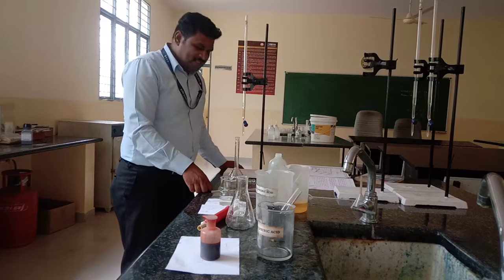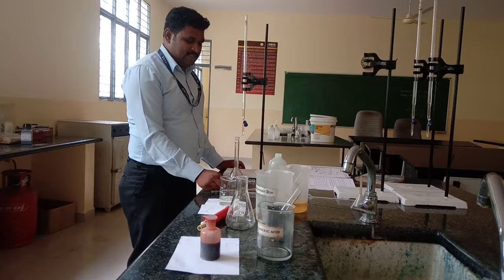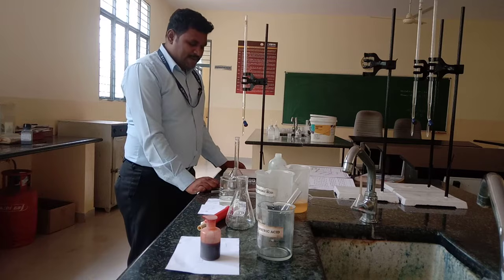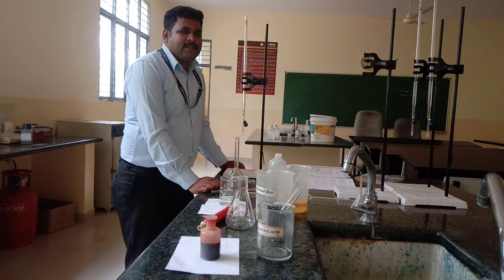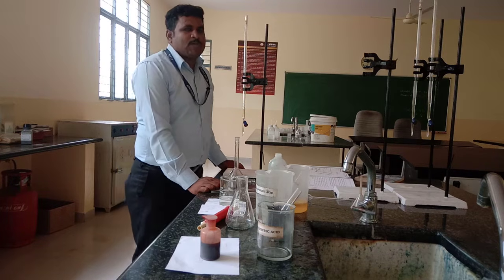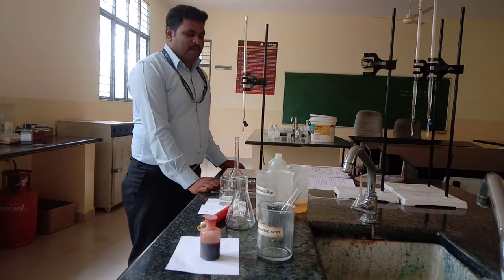Dear students, today we will learn about the chemical oxygen demand experiment. Chemical oxygen demand is an industrially important parameter to check the pollution level of industrial wastewater, and we can also use it for analysis of industrial wastewater.